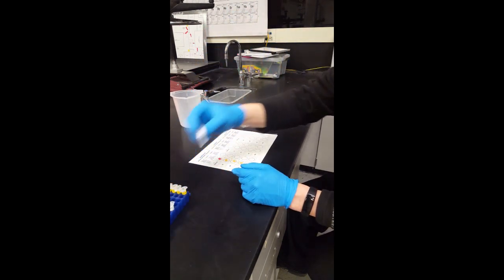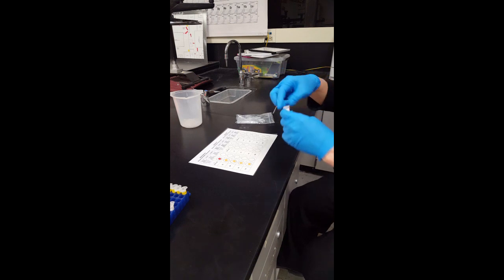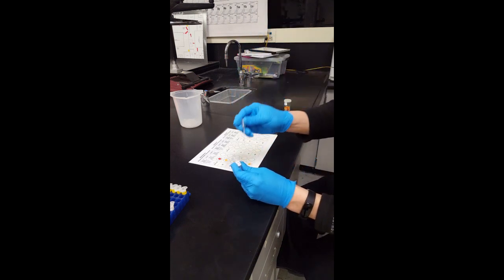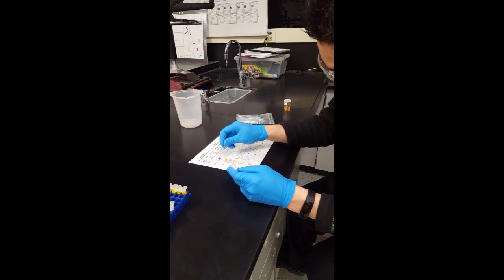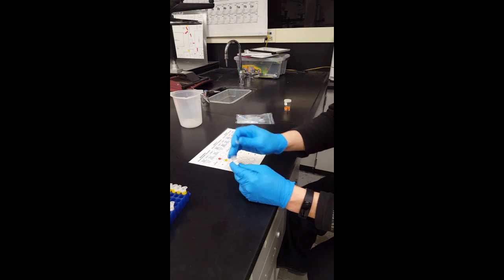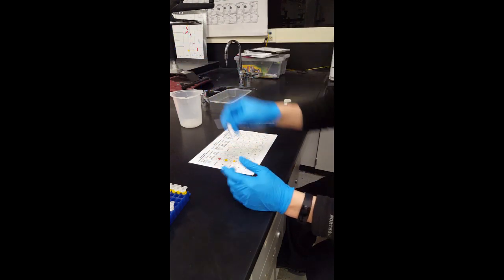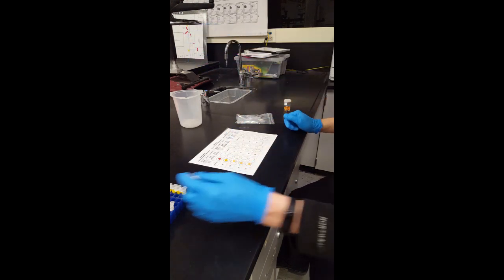And then we are going to do the next one which is Ana Garcia 30 minutes. So same thing. Grab a new transfer pipette. Roughly about one or two drops. Put the rest back in. And then you give it to your table partners on the other side. And then when they are done they can throw it away.